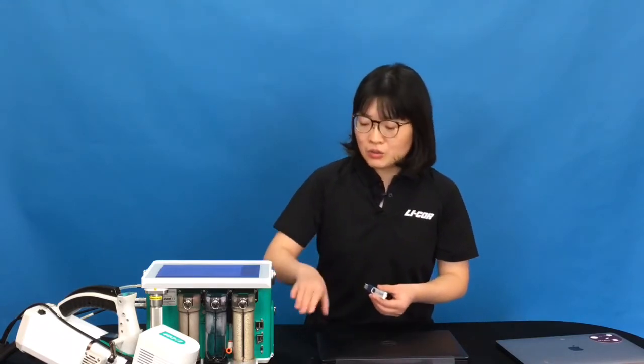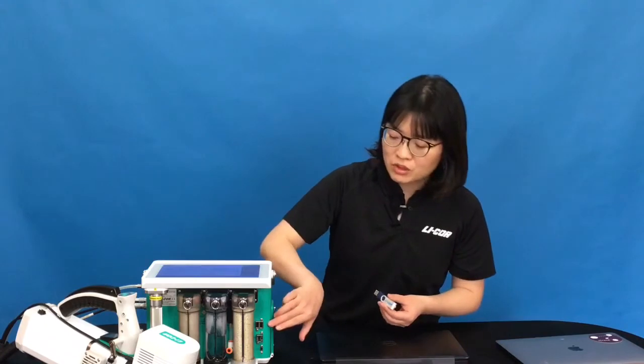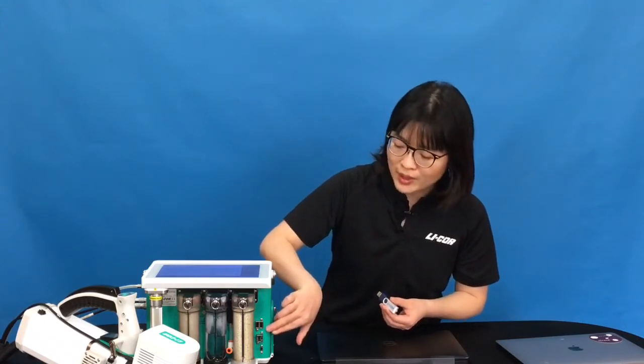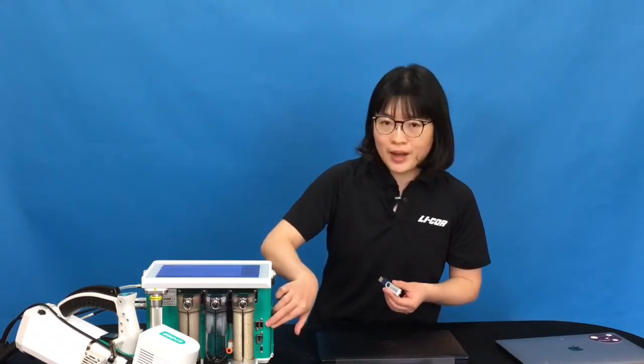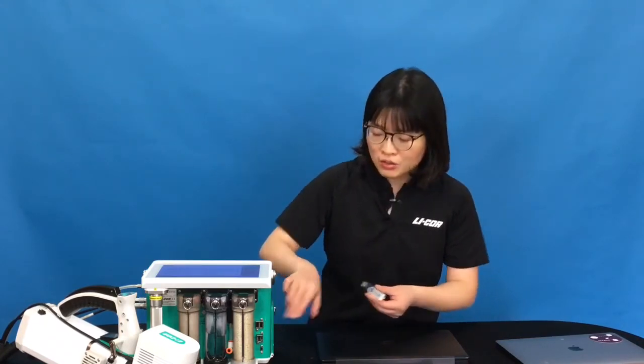To use a USB storage device, you can just simply plug it into one of the two USB ports at the back of your console.